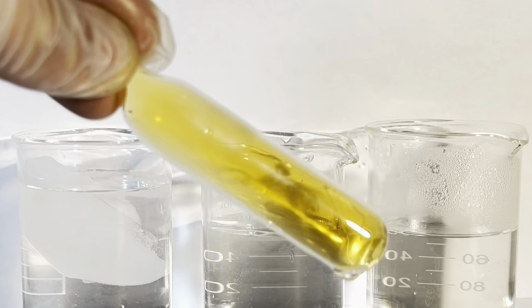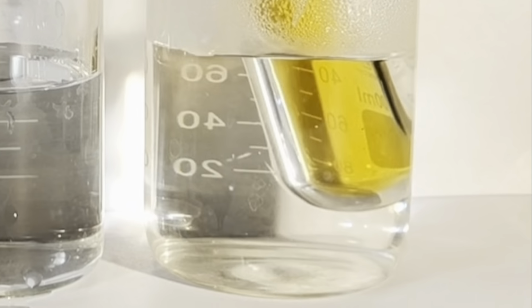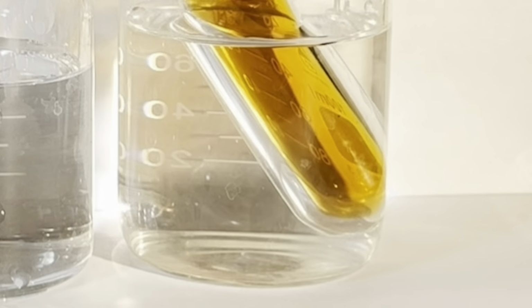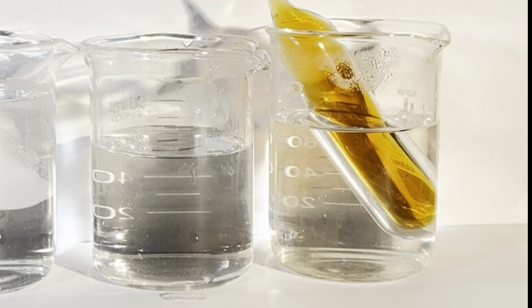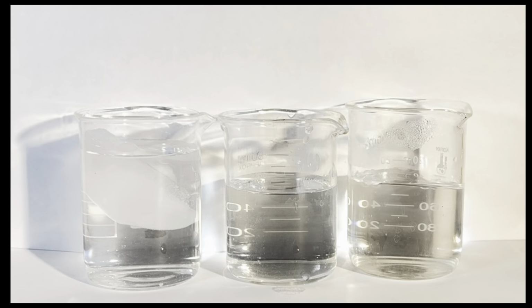Now we're going to move on to the hot water bath. And this is a real striking color change. The water's about 70 degrees C, and at higher temperatures, the formation of the monomer nitrogen dioxide is heavily favored. You can see that by the gas in the ampule darkening like that.